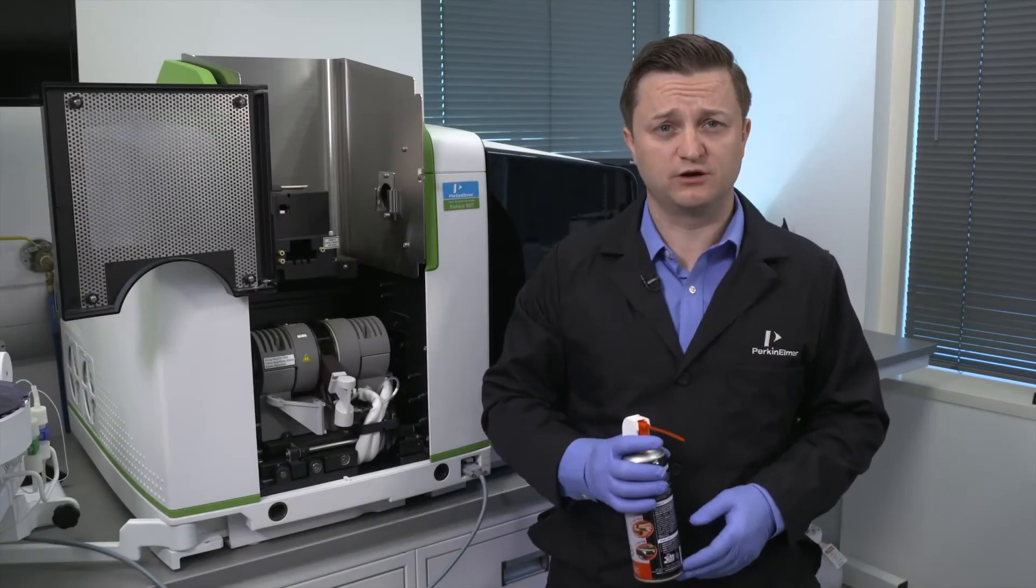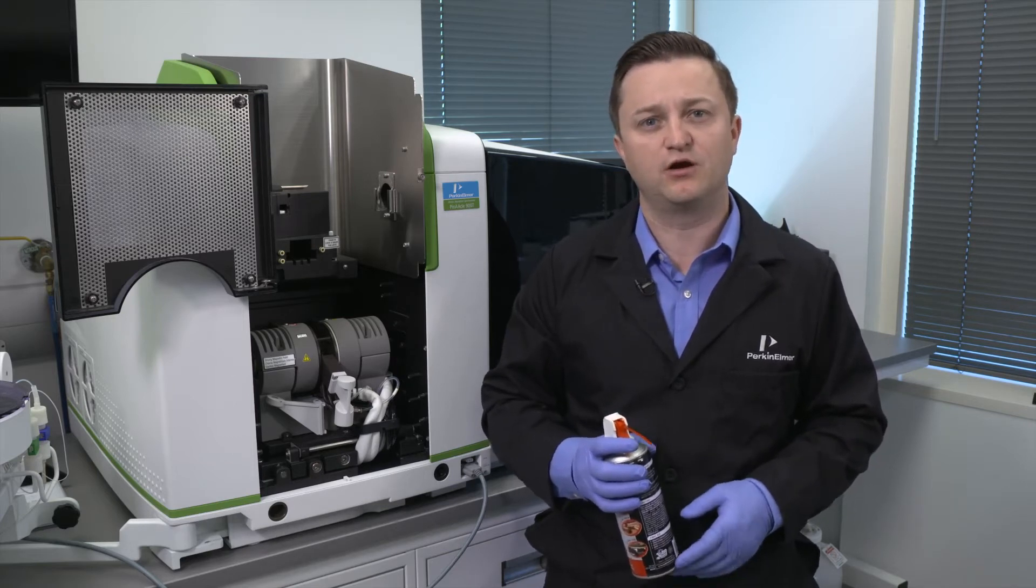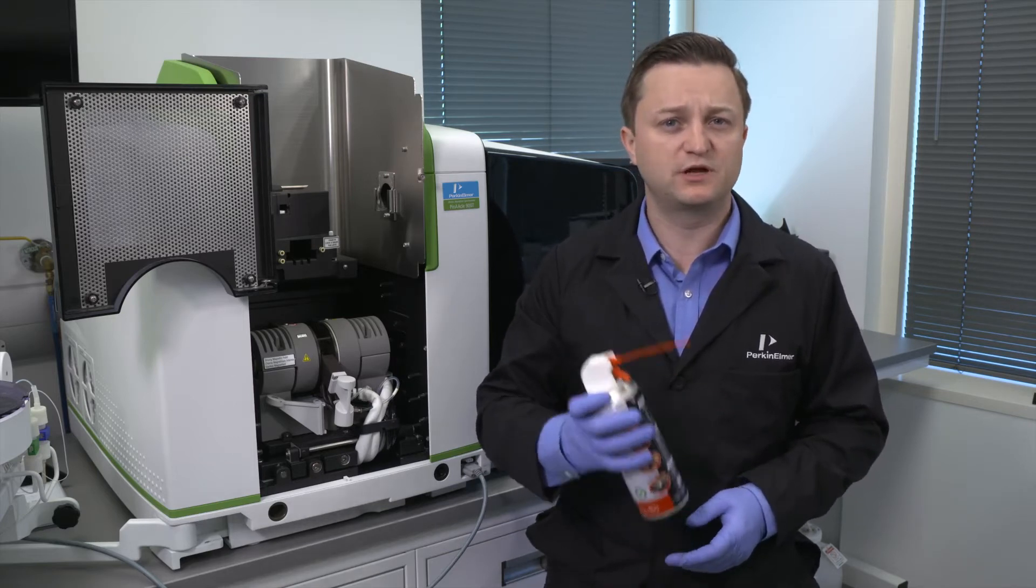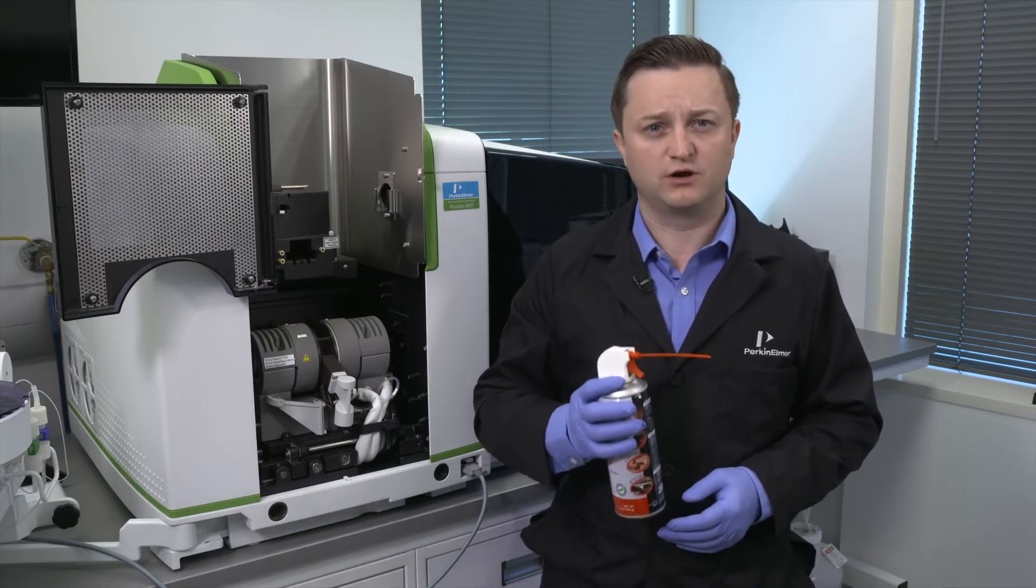Now let's replace the rear contact. Before you do so, make sure the housing is completely free of any debris or particulate matter. Use some clean, dry compressed gas to blow out the housing for the rear contact.